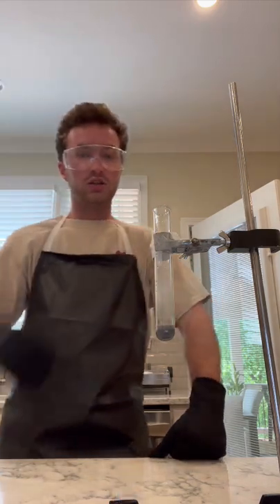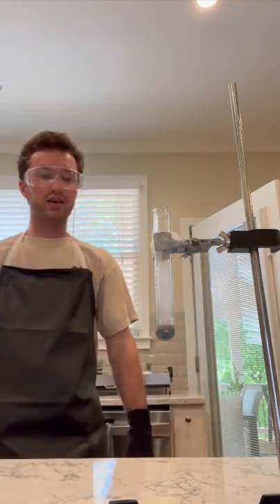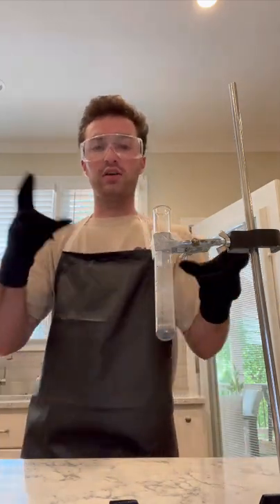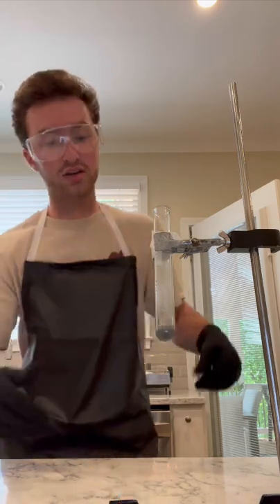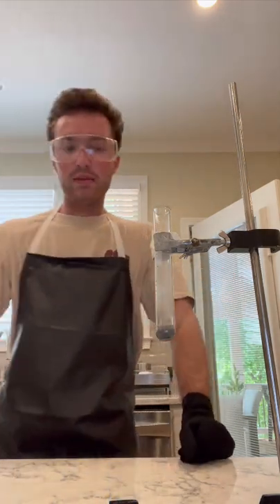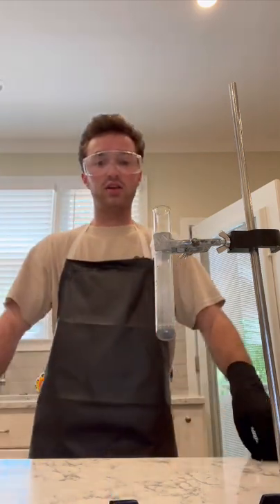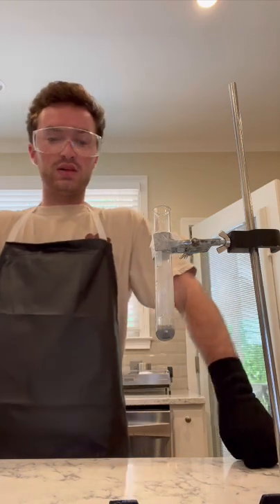So, now that the reaction is completely done, you can see, obviously, there's a color change going on. Water went from clear to gray, and the gray aluminum foil kind of combined, so the water is completely gray right now. I'm not sure if you can see from the bubbles or not, but it's clearly an exothermic reaction.